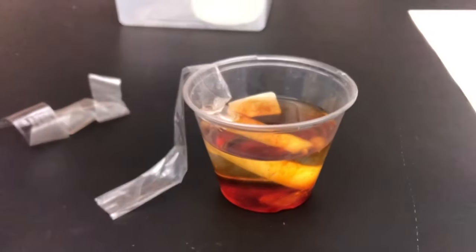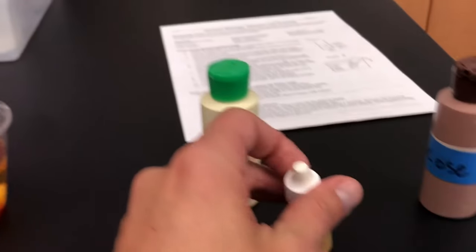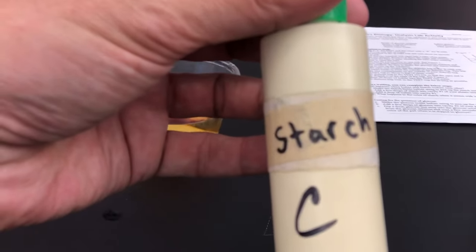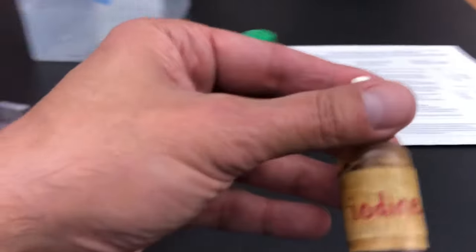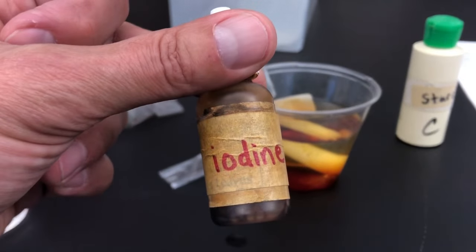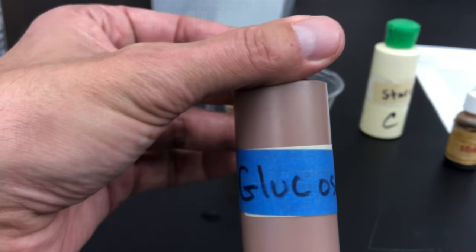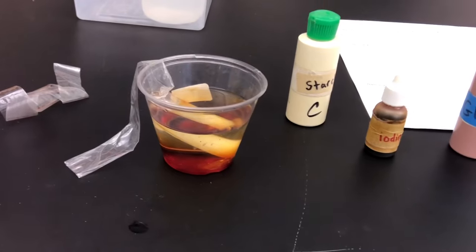Now I'm going to let this testing cup sit — the longer it sits, the better. Remember, what we're trying to figure out is which of these three molecules — starch, iodine, and glucose — are able to pass through the dialysis membrane. I know there's starch inside the membrane; does it diffuse out into the cup? I know there's iodine in the cup; does it diffuse into the dialysis membrane? And glucose — I added five milliliters inside the membrane; does it diffuse outward into the cup? I'm going to let this sit for 20–30 minutes and pause the video.